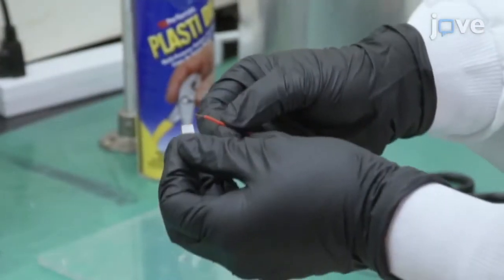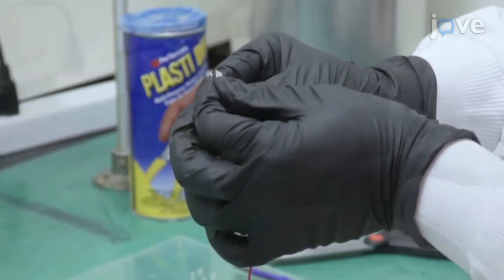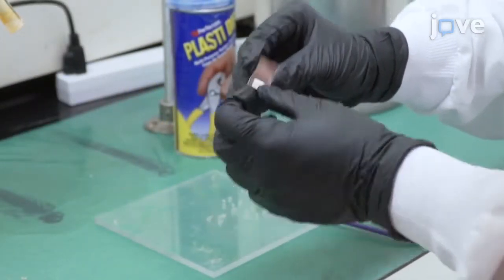Use an appropriate conductive adhesive to electrically connect one end of the wire to the unpolished side of the bulk sample.